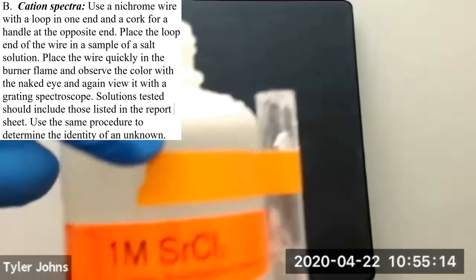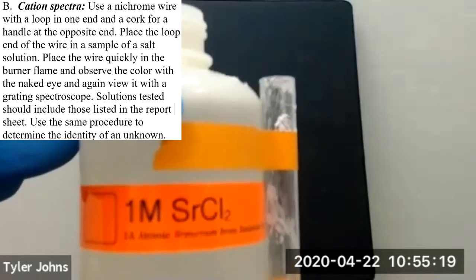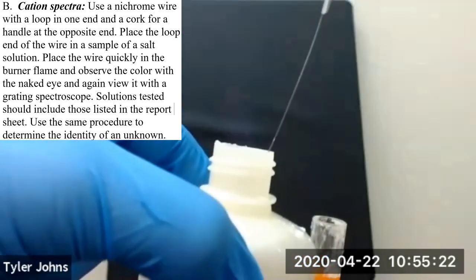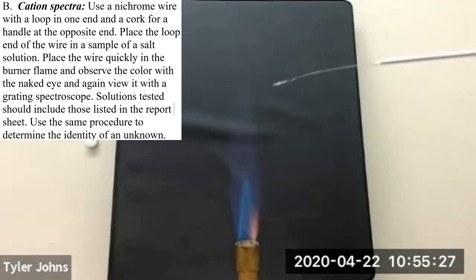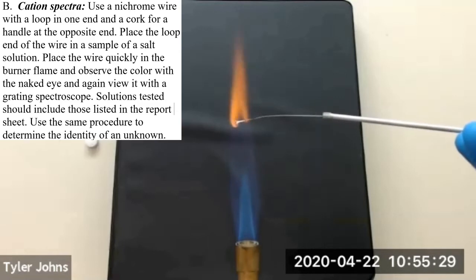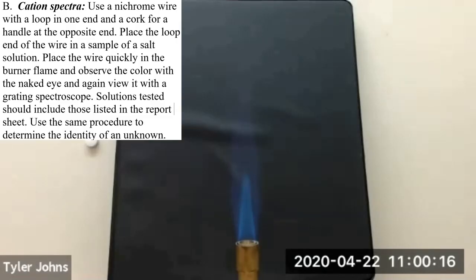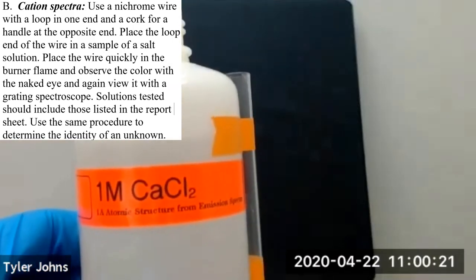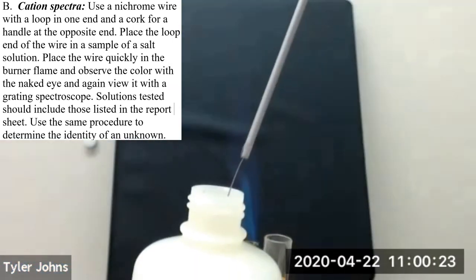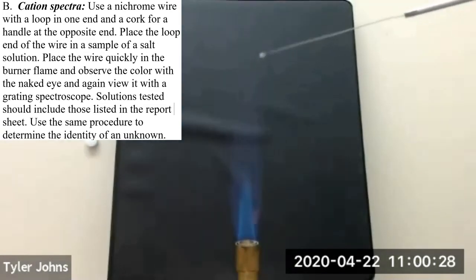So the next cation spectra we'll be looking at is strontium. So we'll take our strontium chloride solution, place our nichrome wire in, and then place it in the flame. The next cation spectra we'll be looking at is calcium. So we'll take our calcium chloride solution, insert our nichrome wire, and place it in the flame.